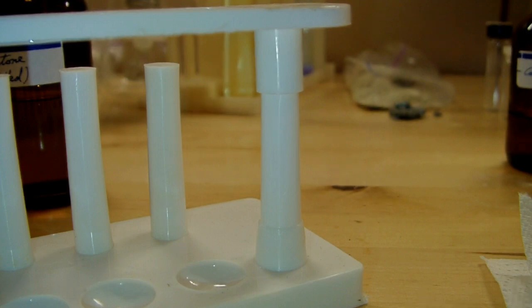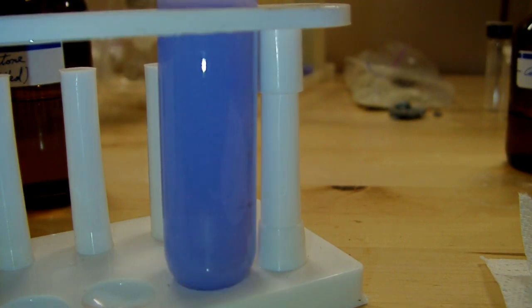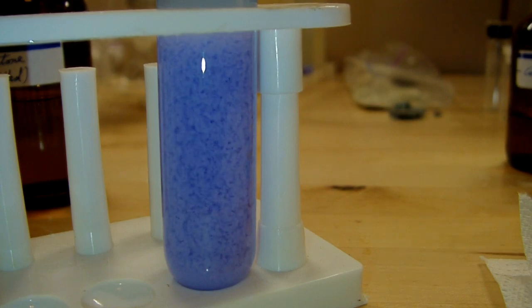After adding a whole bunch of acetone, I had to move to a larger test tube. And I wanted to show you how cool this is to watch it settle because, like I said, it's such a heavy precipitate. So this is just after mixing it again. And now if I leave it alone for a minute, it'll settle out and it's really beautiful to watch. And this is in real time, by the way.